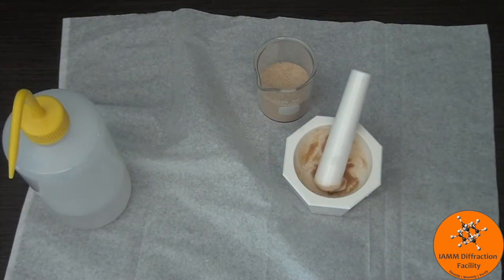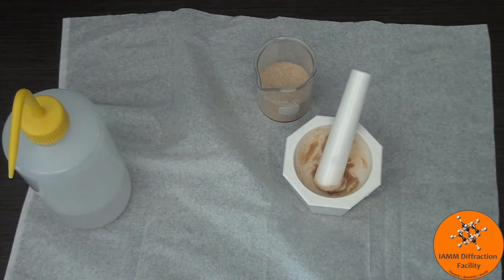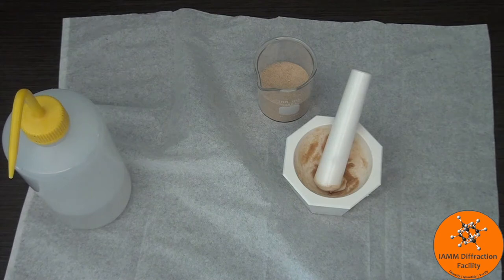If the sand is feeling rather smooth, or if you think that you might be done, then go ahead and wipe everything out and clean it.